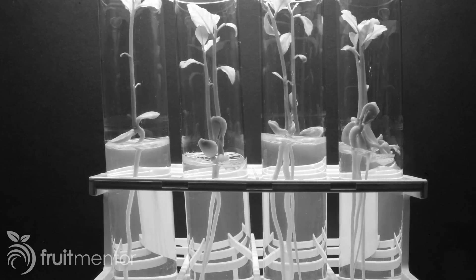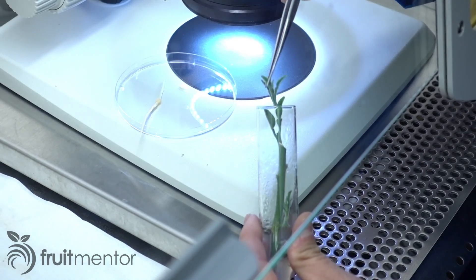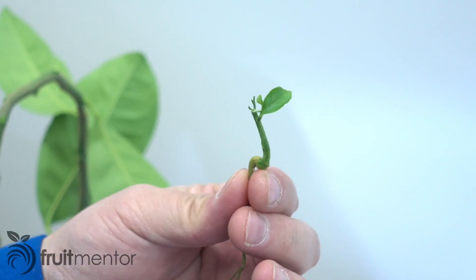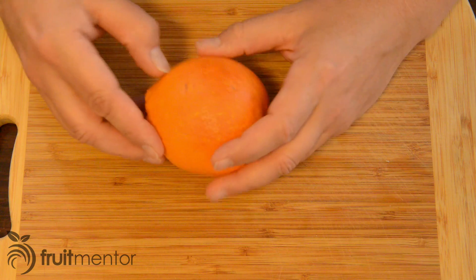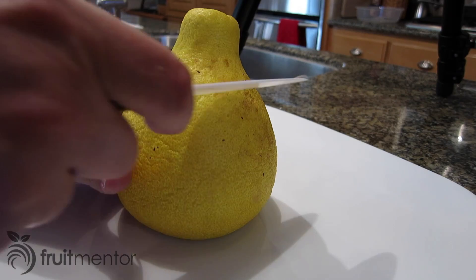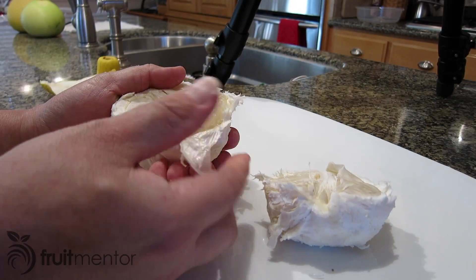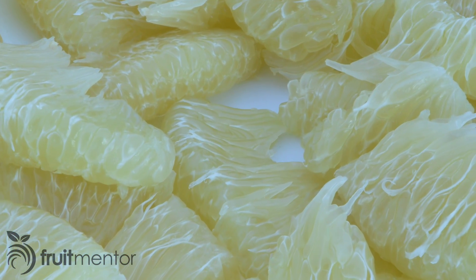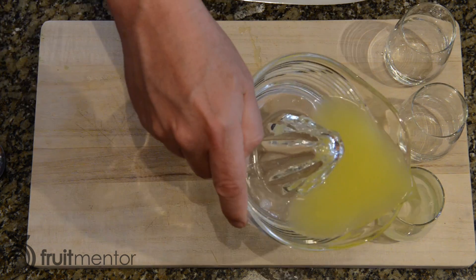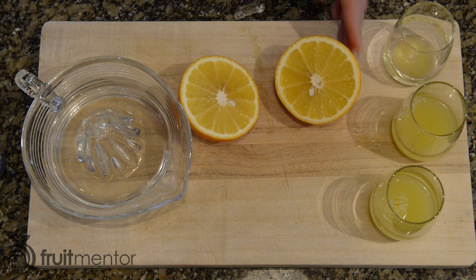In this video, I will show techniques including grafting citrus trees under a microscope that California scientists use to avoid all known graft-transmissible diseases when introducing a citrus variety to the state. Any citrus variety can be introduced to the state of California through the Citrus Clonal Protection Program, or CCPP, at the University of California, Riverside. I have requested some citrus variety introductions, and at the end of the video, we'll provide more information about variety introduction and how you can order a citrus variety that is not in California.